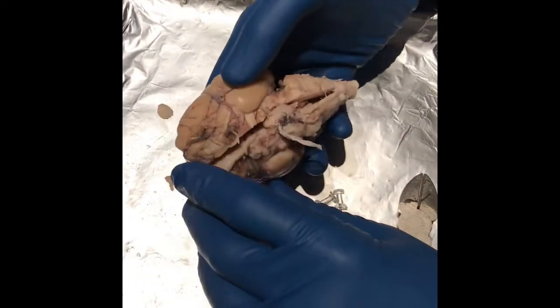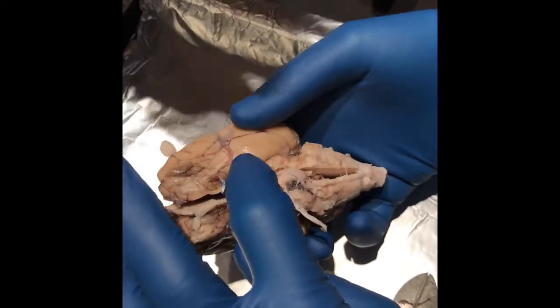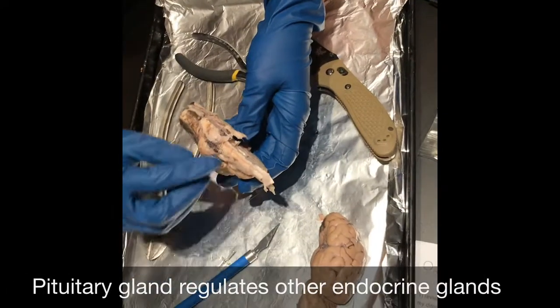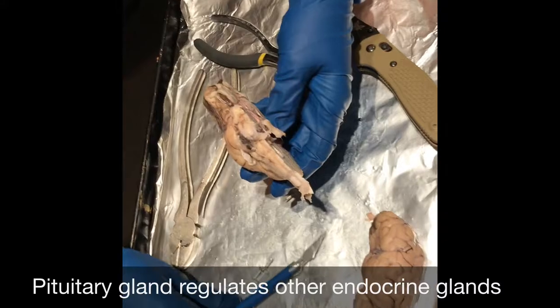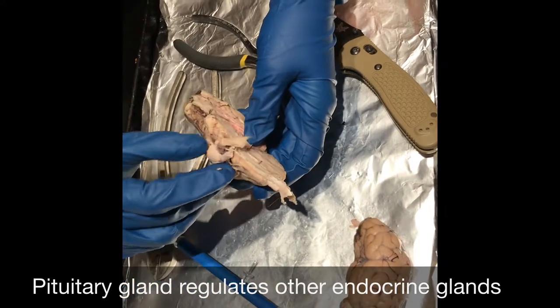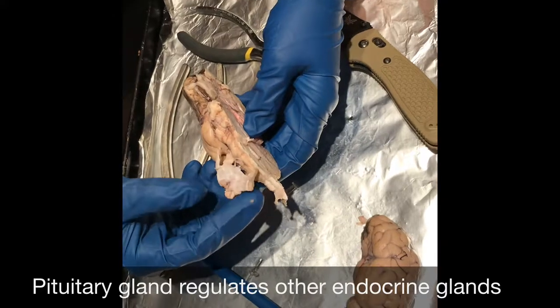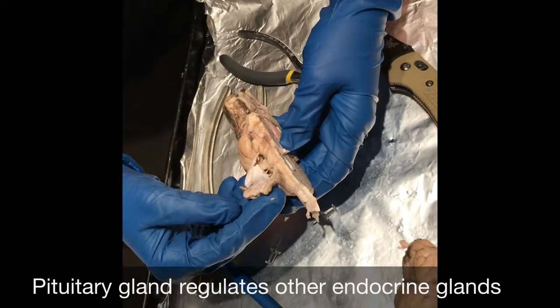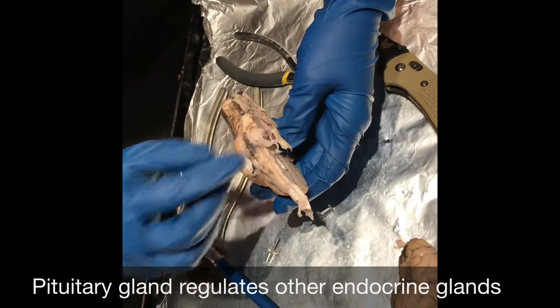So if we put it back together, that's the optic chiasm there. Very cool. So this right here is actually the pituitary gland, and you can kind of tell because there's still dura mater underneath it, and that's usually what gets ripped off when you get the sheep brains.